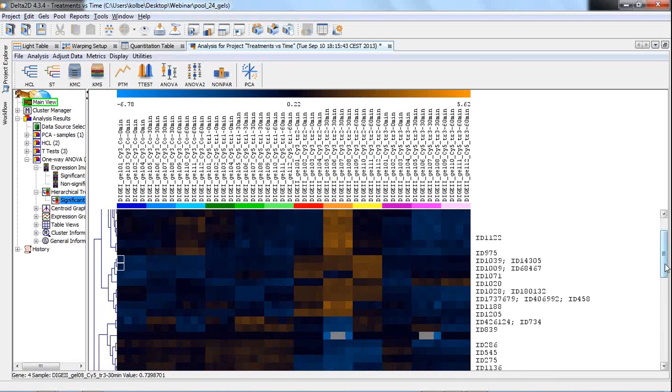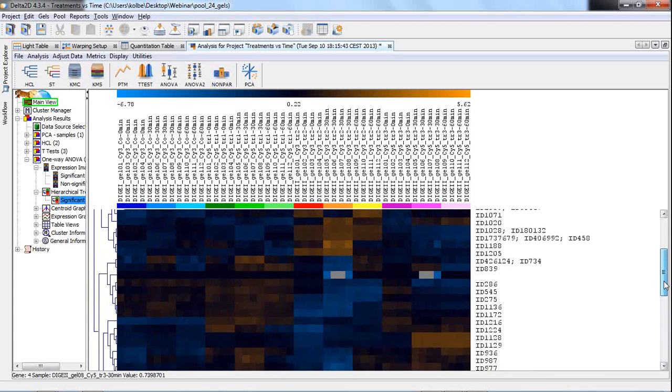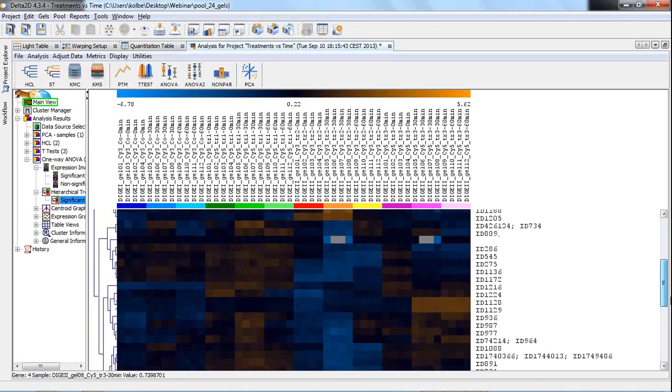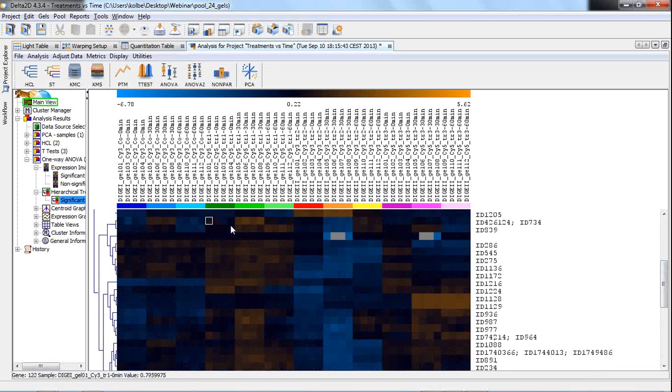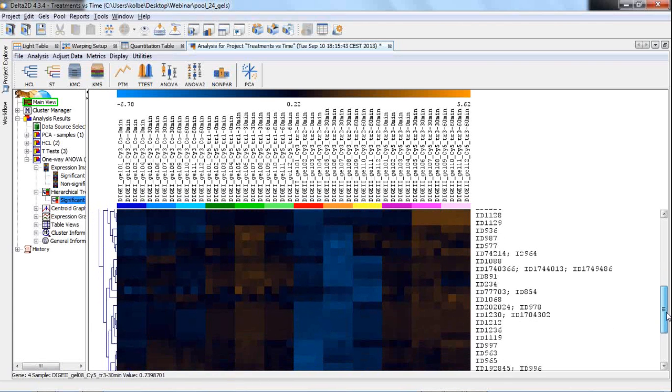Here we have a number of significant expression profiles. Among them will be 5 false positives. We don't know which of them, but now you can continue analyzing the different clusters, why they are different. And it's nice to observe these blocks here. I hope that you can see some differences in intensity, and that these clusters form certain spots and blocks where the spot quantities really change between the clusters. Of course, you have to know what you're looking for, which changes are of interest between cell lines, between points in time, between which combination of cell lines and points in times. So this is completely up to you, and then give a good reason for your publication.